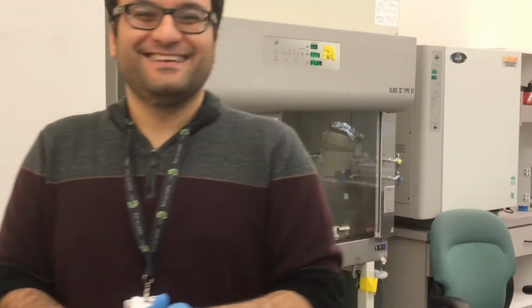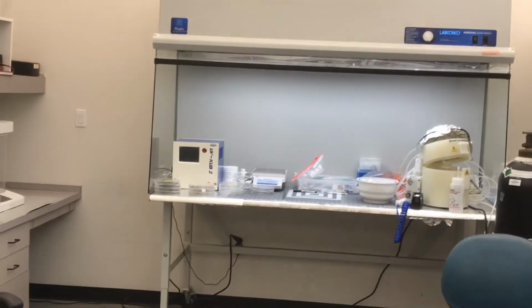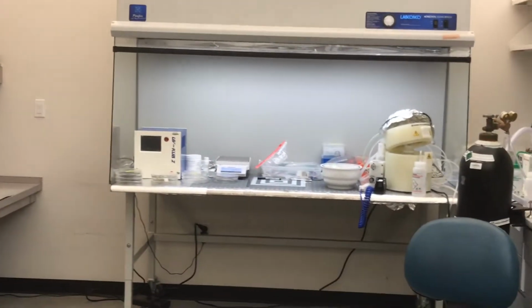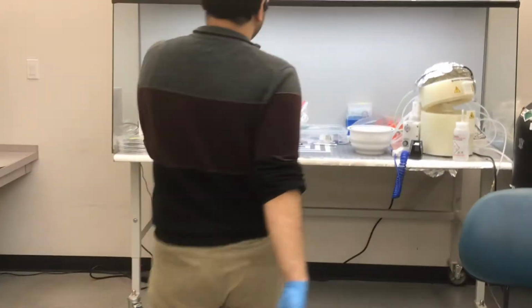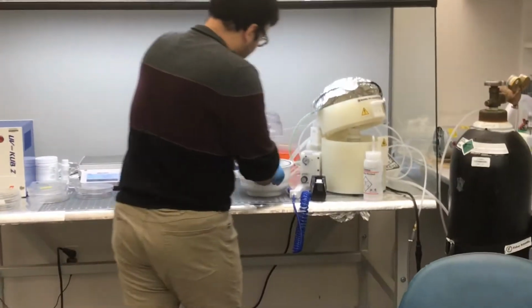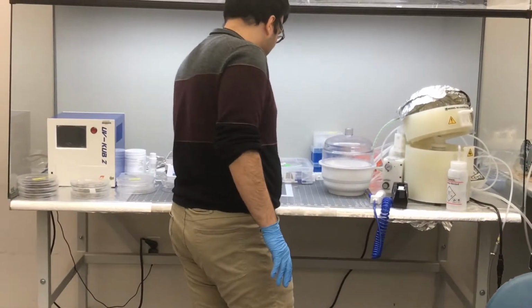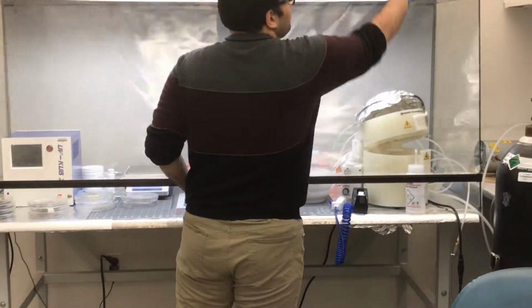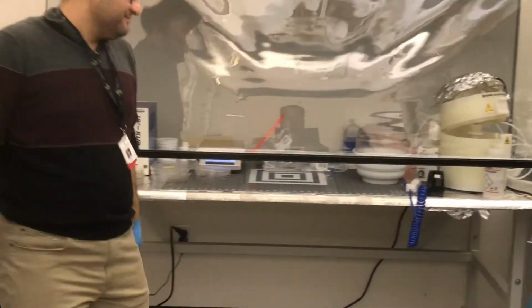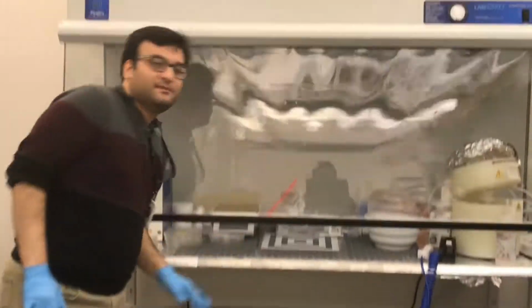So we don't have to come, we just have to put it there. And when you put it there, this needs to be closed. Then we should close everything and turn off, just as we do right now. Okay. Whenever you finish, you should clean everything, because everything should come back to the same state. You see now everything is clean. So we close it, we turn off, and then done. And then it should be inside overnight, yes.